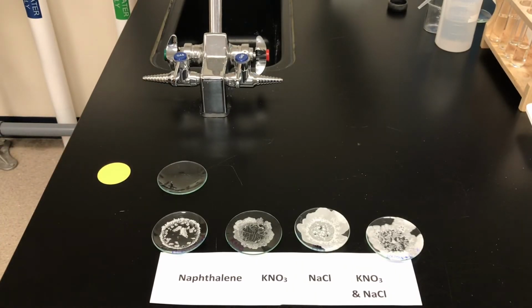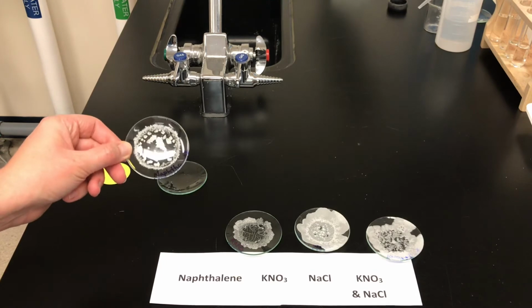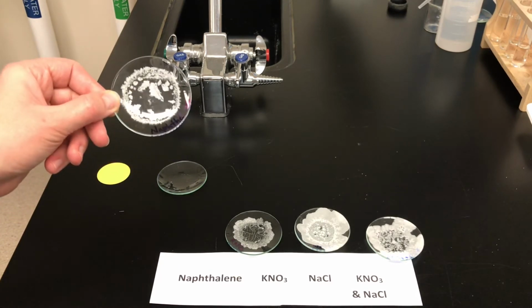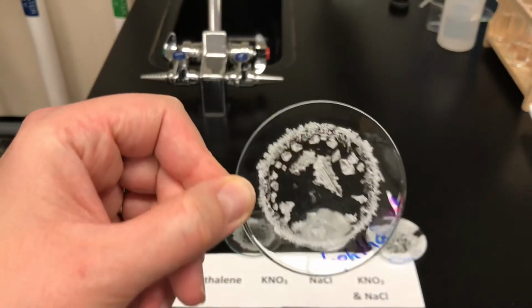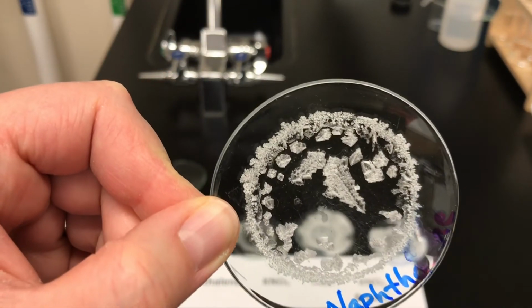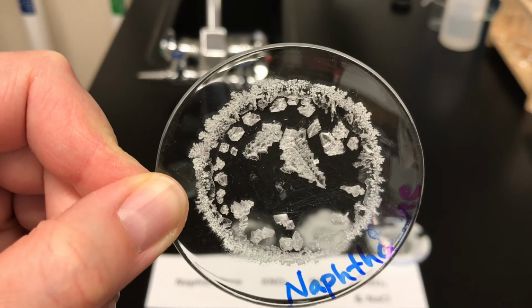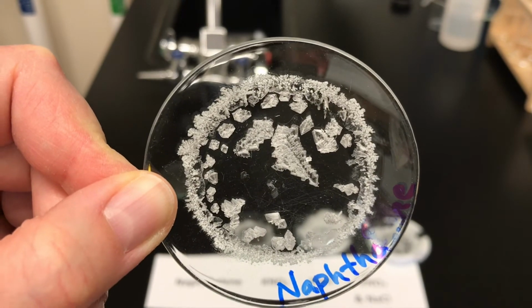The naphthalene gas escaped. So this morning, on day 2, a new solution was prepared on the watch glass and the alcohol was allowed to evaporate before the naphthalene was allowed to sublime, and what we're left with now is the characteristic crystal structure of the naphthalene.